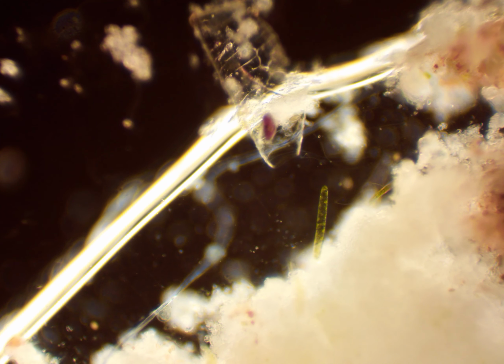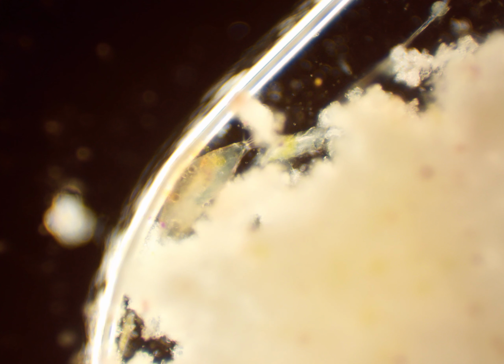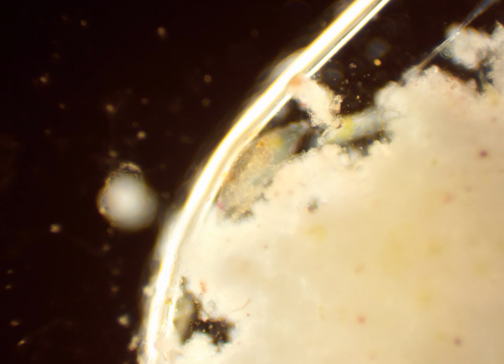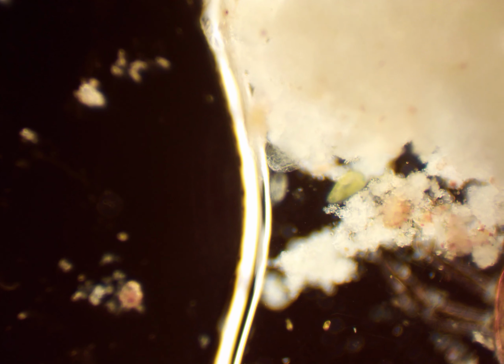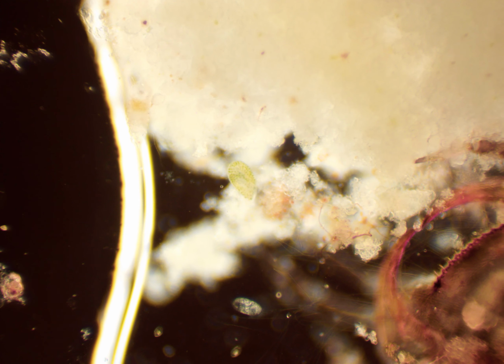It was clumped up with all of this dirt floating on the top, and I sucked it up. This is indeed a mosquito larva. And there is a nauplius of a crustacean called a cyclops, which has been here before. And there is Paramecium bursaria. It's one of the direct children of Paramecium.